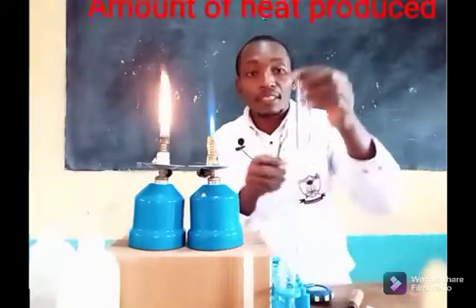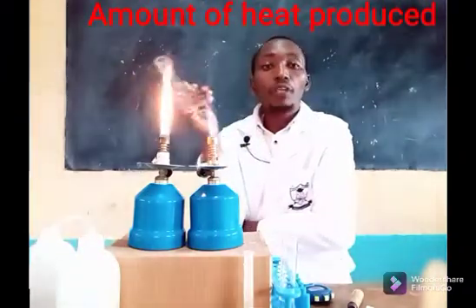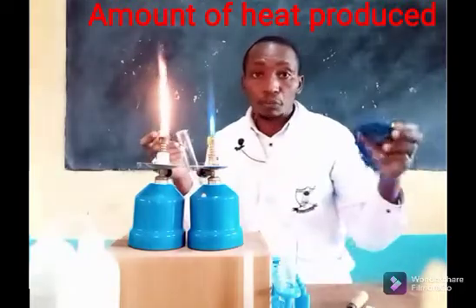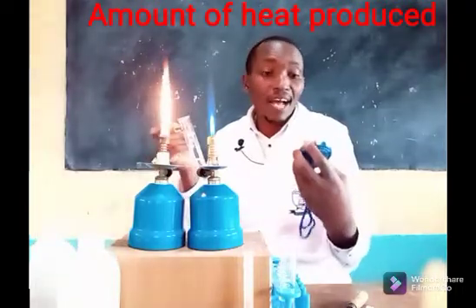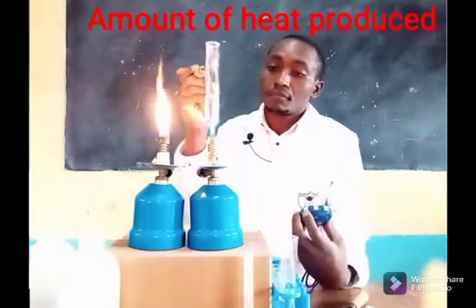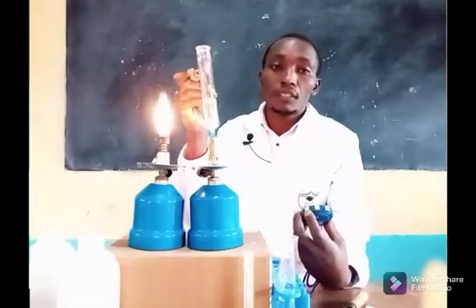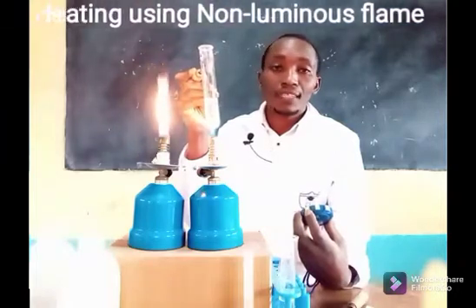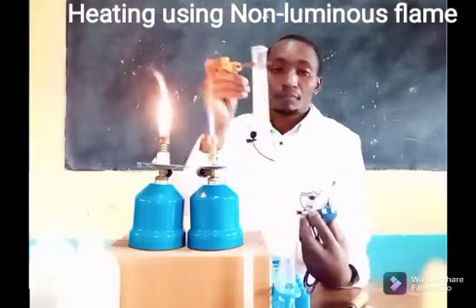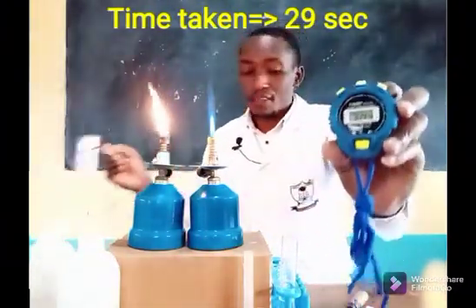I want to consider the heat output. I have 20 cubic centimetres of distilled water and a stopwatch. I will heat the water using the non-luminous flame. On the count of 1, 2, and 3, I start. Within 29 seconds the water has boiled.